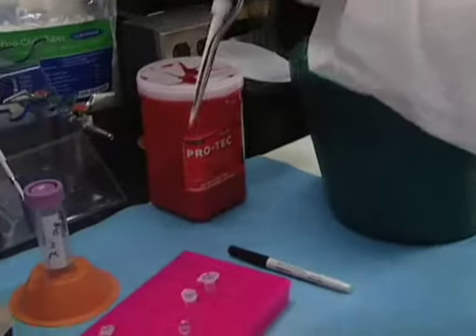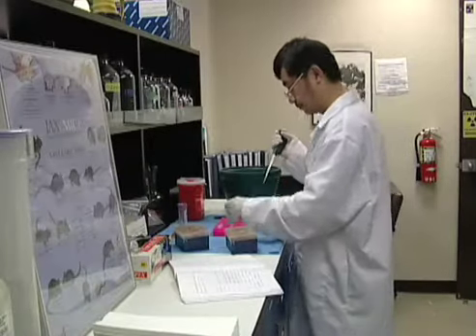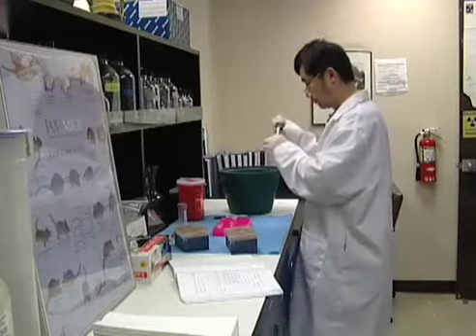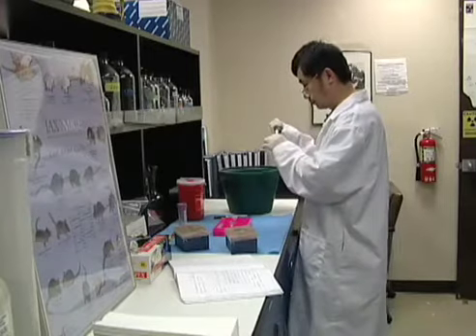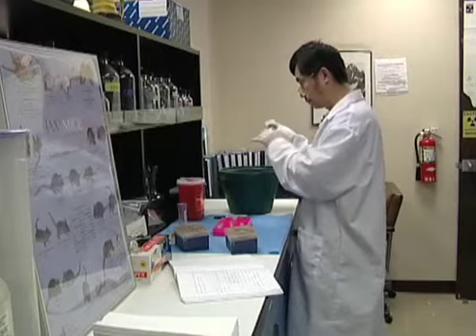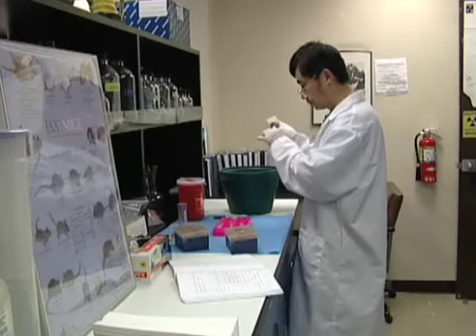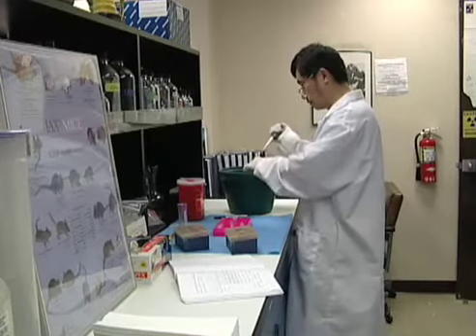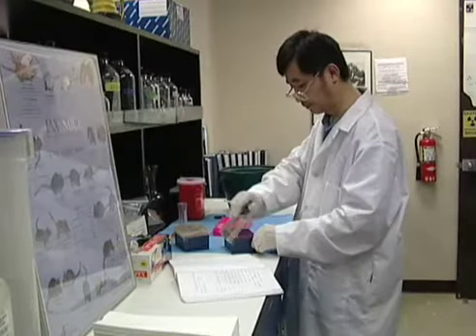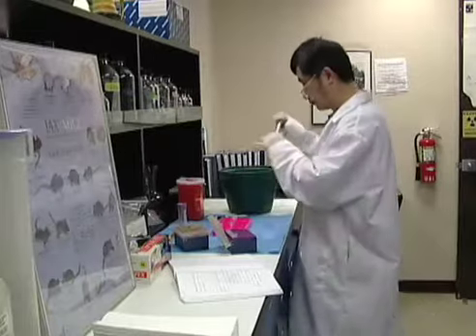We start by taking tissue samples from the heart and homogenizing them. By homogenizing tissue samples, we puree them until they are in a watery consistency. In this gel, one side has a wild type protein and the other has a mutant protein. The same amount of protein is loaded into both sides of the gel.